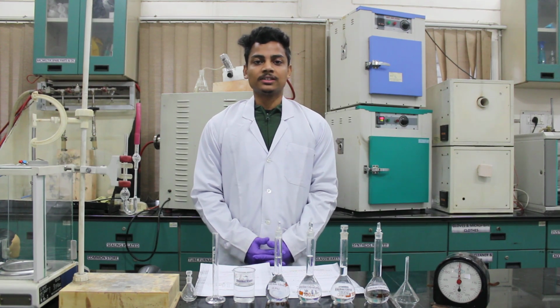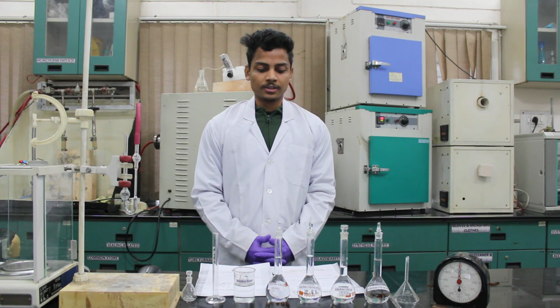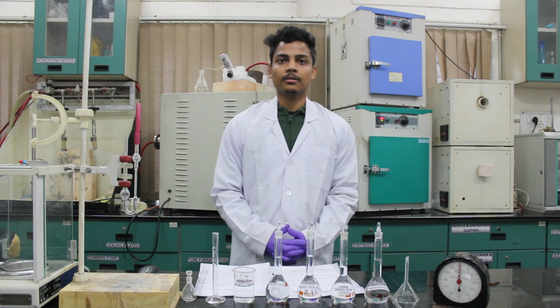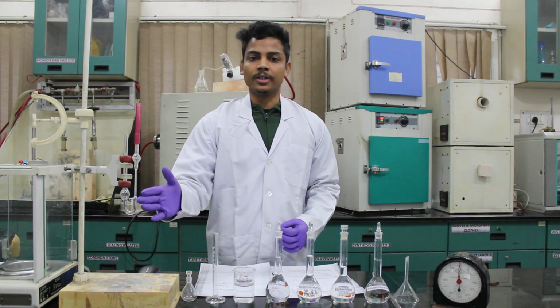Hello everyone, myself Sujan. Today I am going to perform determination of composition of mixtures of liquid using viscometer. To perform this experiment, we will be using Ostwald's viscometer.